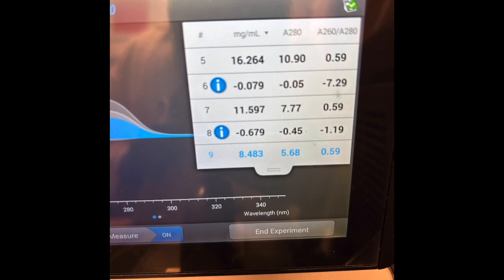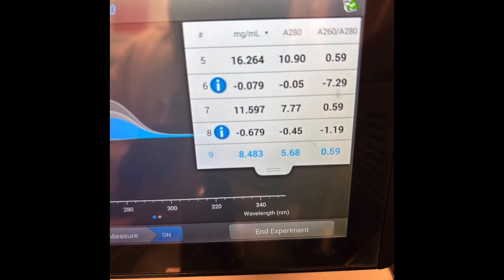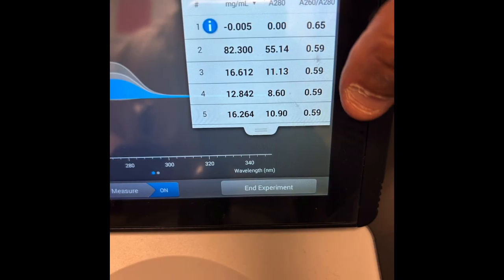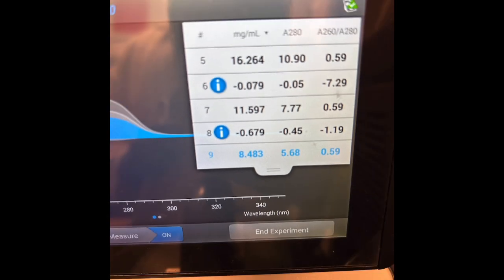So as you can see, the Opentrons does about 12 or 16 milligrams per milliliter, which is about a 1 to 5 dilution, or between 1 to 5 to 1 to 10 dilution, when it should be doing 1 to 10, since it is 10% of that 10% stock. My number 9 is my by hand dilution, where I added 1 microliter by hand. As you can see, it is approximately 1 to 10, since it's 8 milligrams per milliliter about, which proves that it was not an outside factor, but the Opentrons causing the problems, or maybe my protocol.